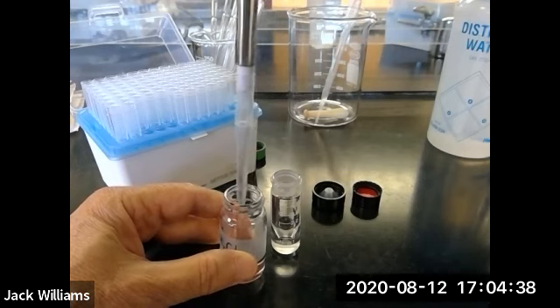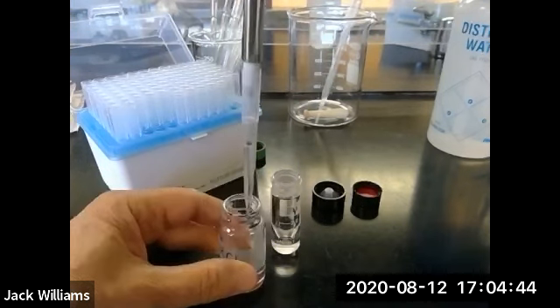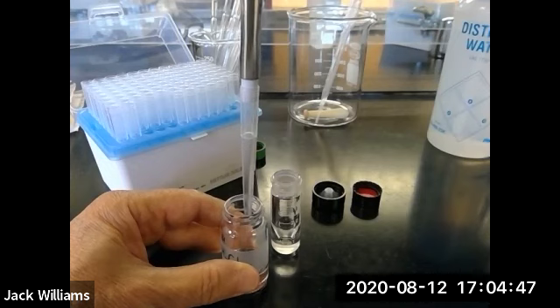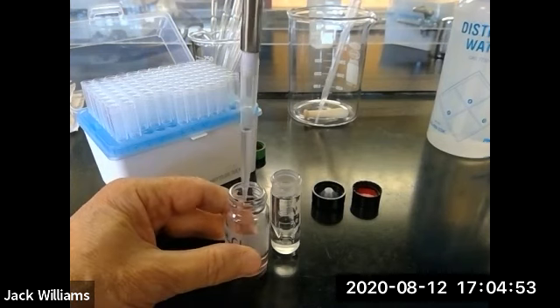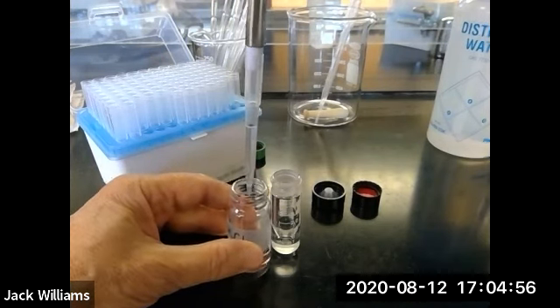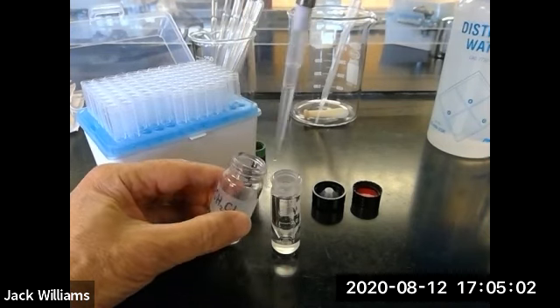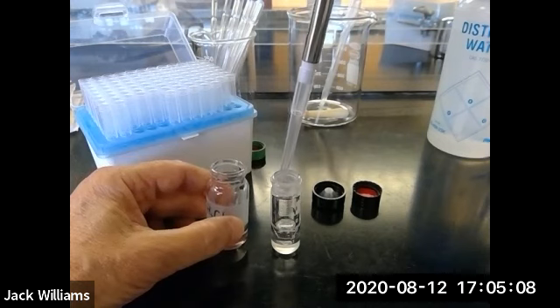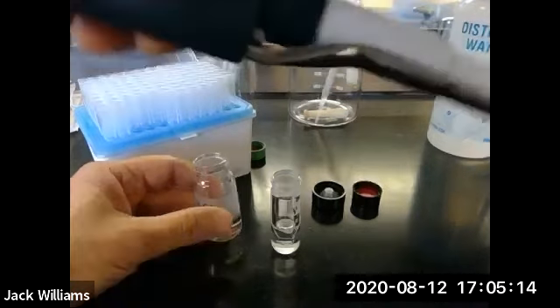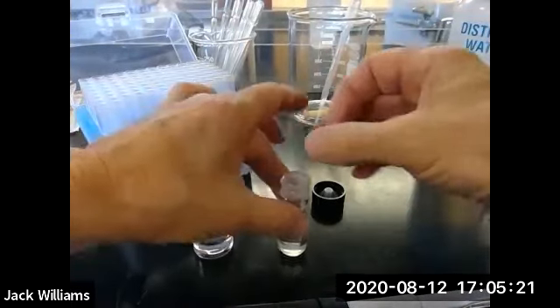So I'm going to aspirate, which means I draw it in slowly. See, now it's slowing down. Try it again. So you do this 2 or 3 times. See how it's really slowing down? So now I'm confident that I can do this, isn't that nice? Without dripping it over the tabletop. Now we'll go down to the first stop, and then that little extra drop from the tip. All right, so that's how you transfer into your conical vial. We're going to put the lid on the conical vial.